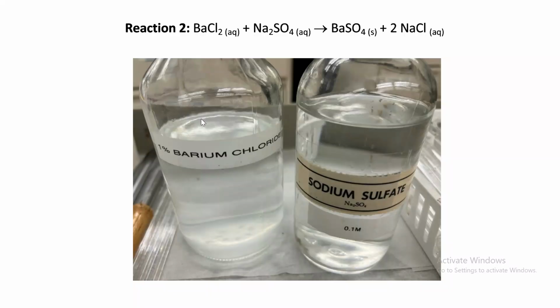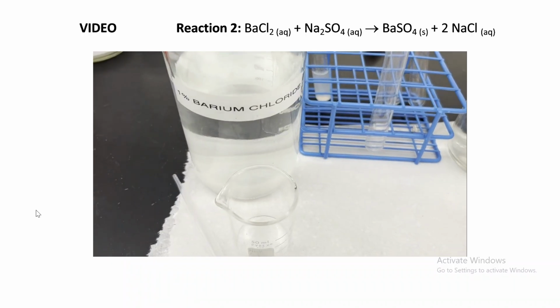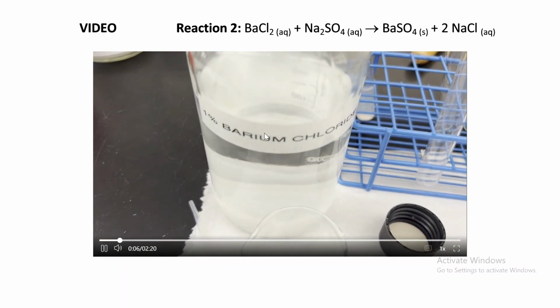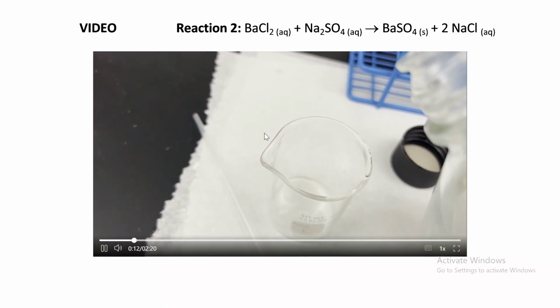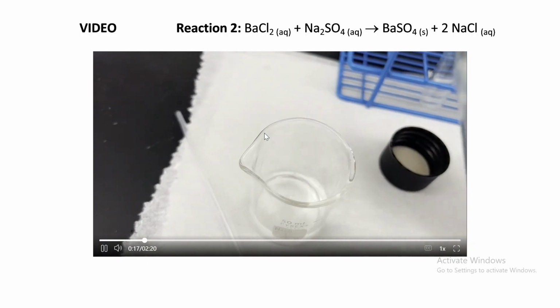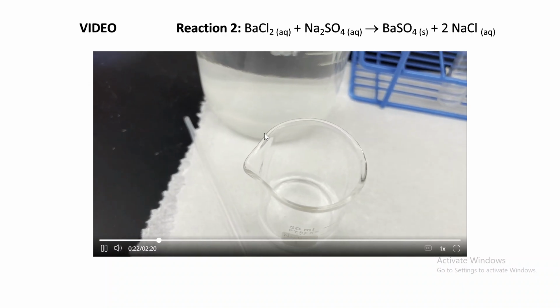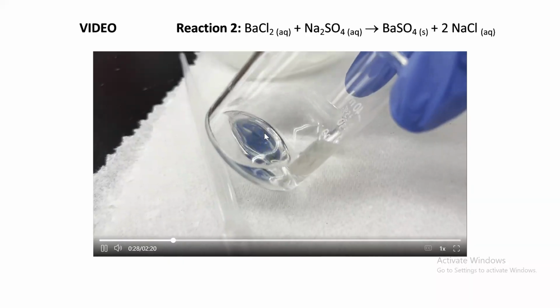The next reaction is between barium chloride and sodium sulfate. Again, let's go back. So let's see the reaction. Make sure to write down the observation. Barium chloride is a clear colorless liquid. We're using 1% of barium chloride. We're going to pour it in a beaker. This equipment is called a beaker. We're going to close. 1% BaCl2 aqueous. Aqueous means it's dissolved in water.